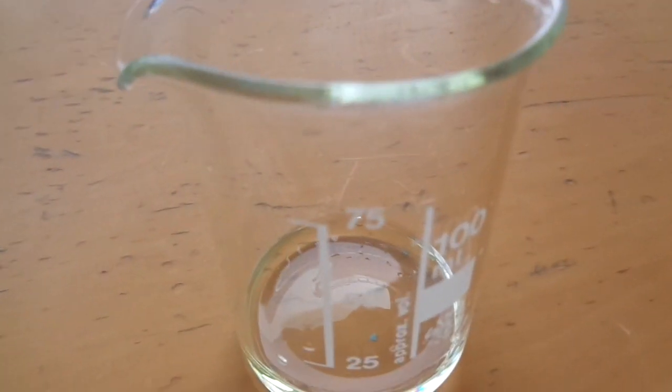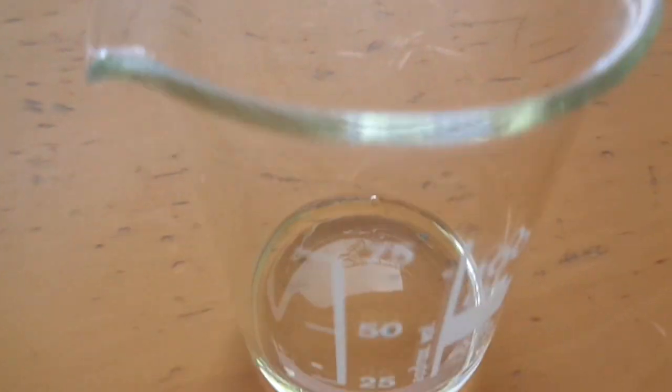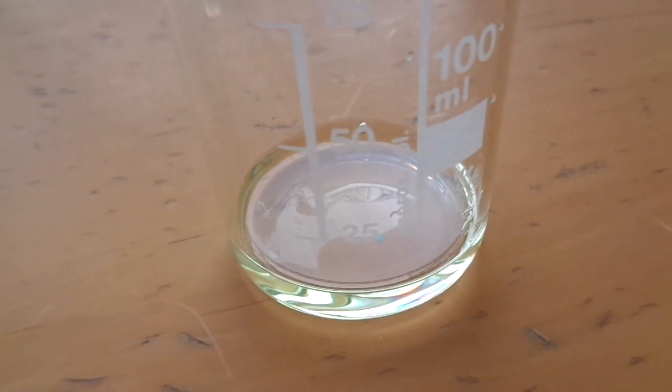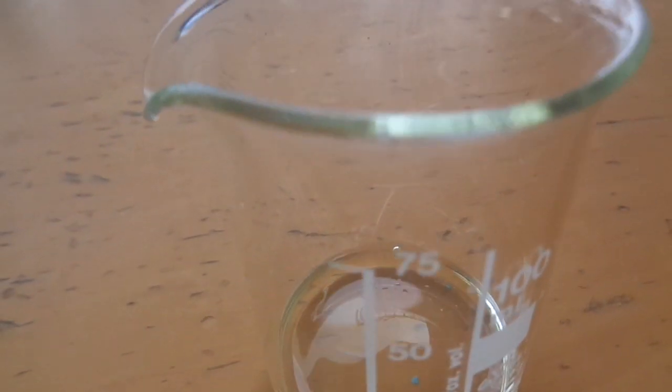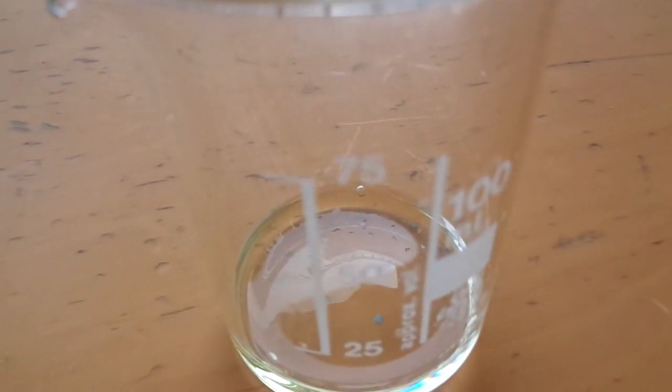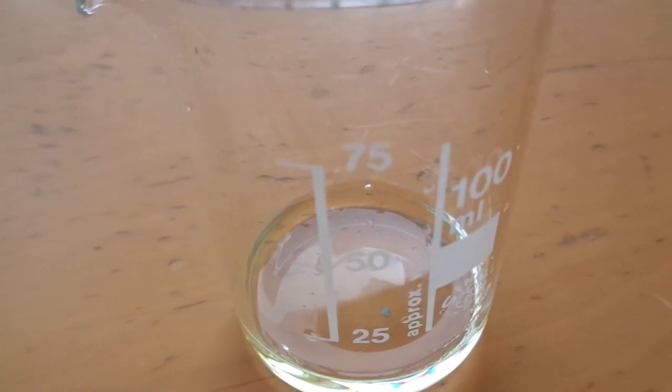So I got here some hydrochloric acid and as you may know hydrochloric acid releases a lot of hydrogen chloride fumes. And you can actually smell them, it's quite potent.